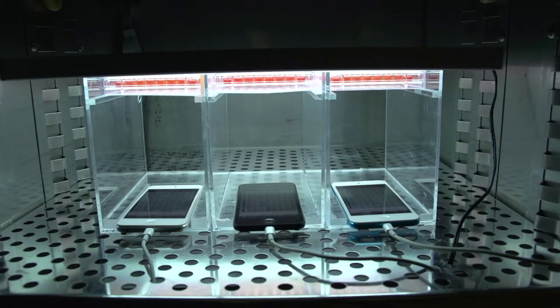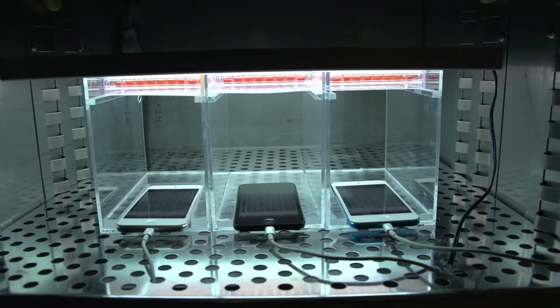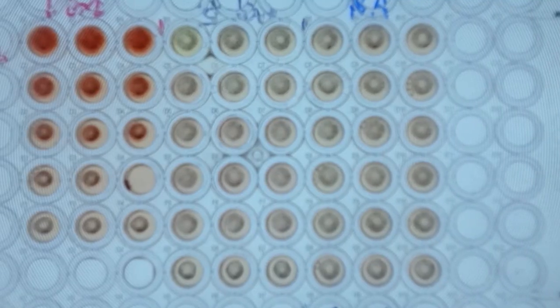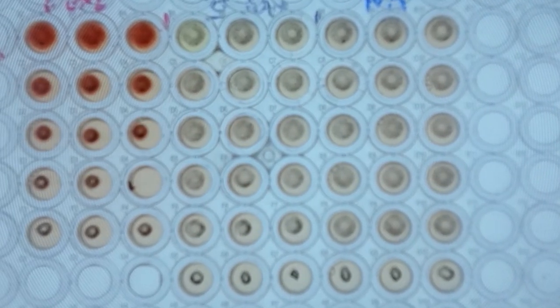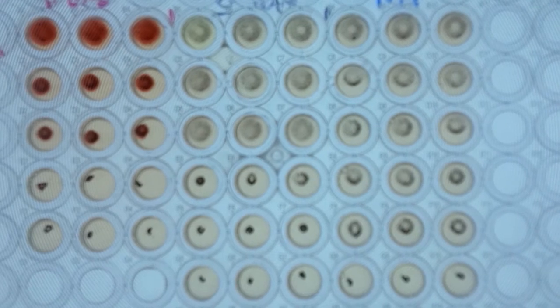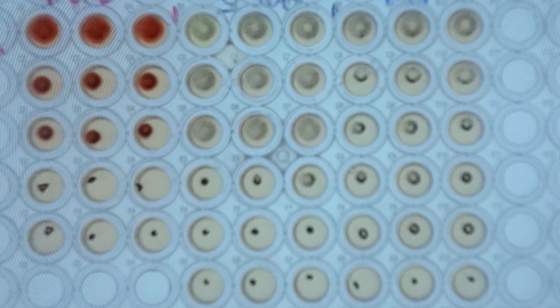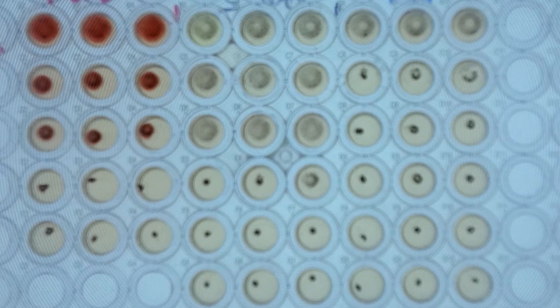You give it the name of the experiment and start your experiment, and overnight it's taking pictures at these intervals. With the lens underneath it, the pictures are very nice and clean, and after that we can go to the analysis of them.